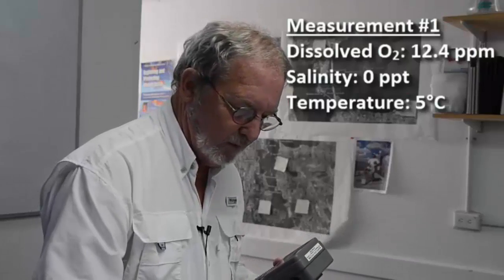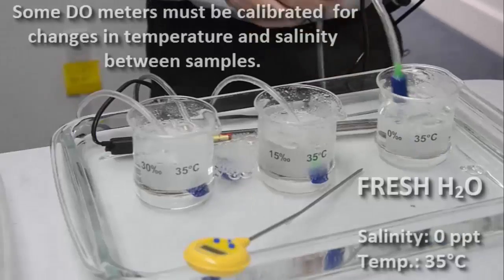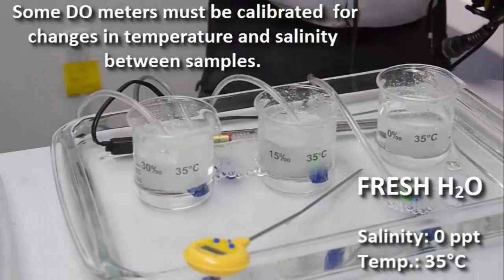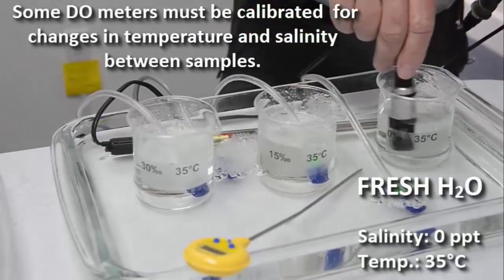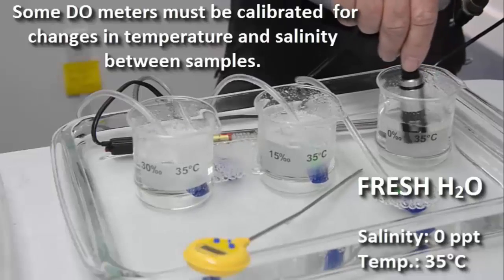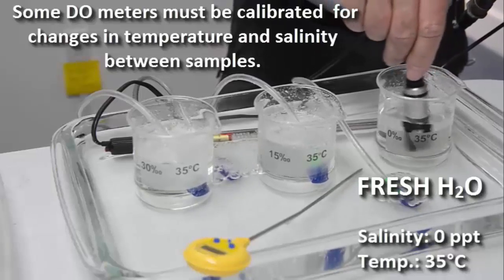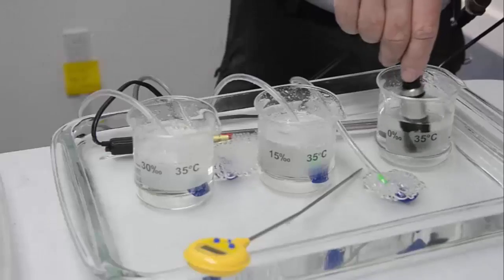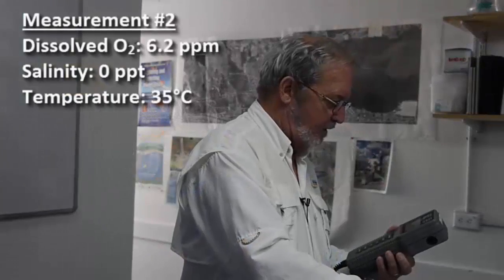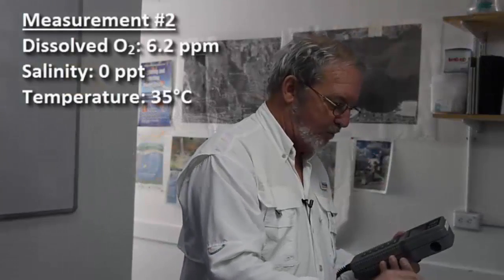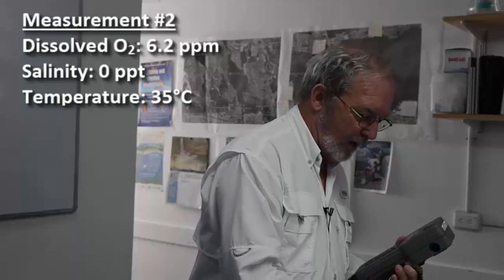Okay now we're going to come over here again, fresh water but at a much warmer temperature, 35 degrees centigrade. Once again put the probe in. 6.2 parts per million. That's fresh water at high temperature.